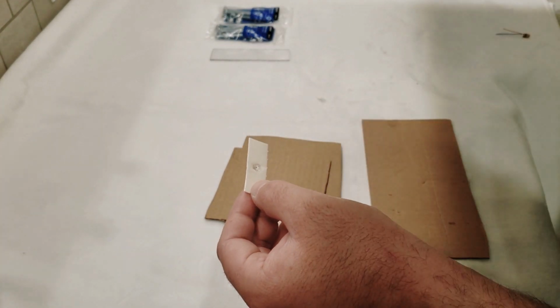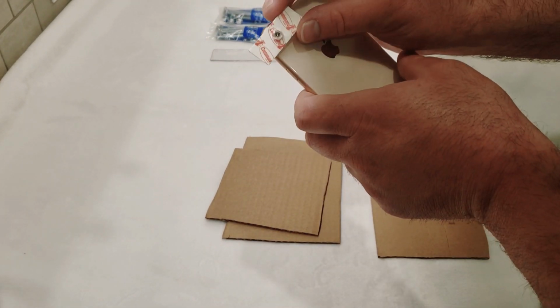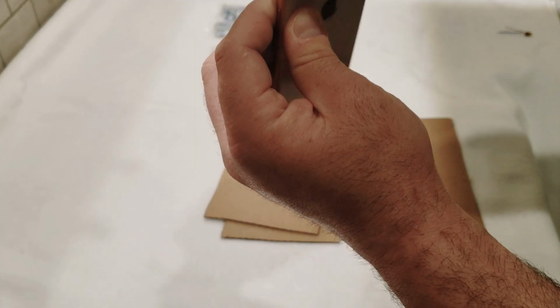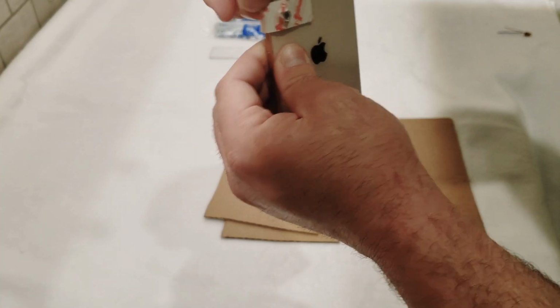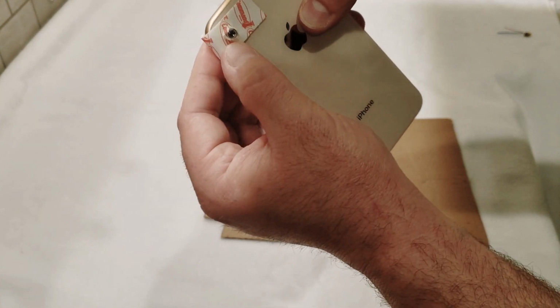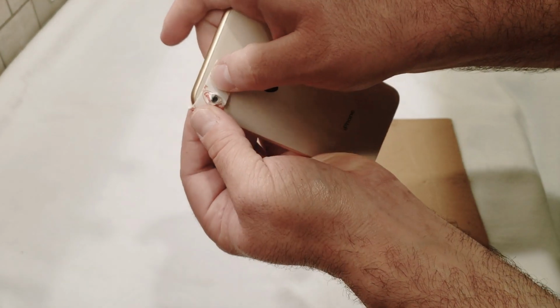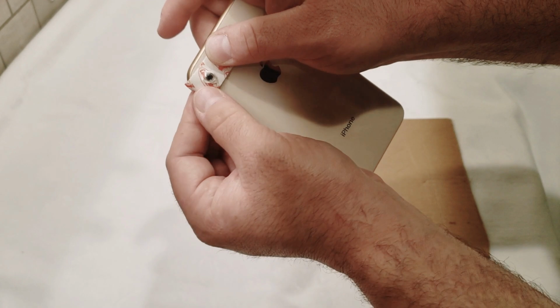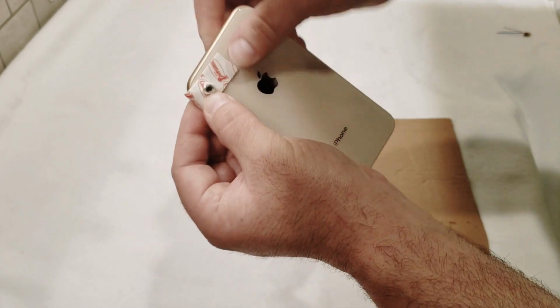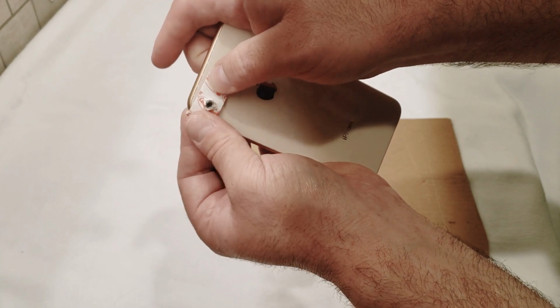Okay, whoops. Didn't quite toss that where I wanted it. We're just going to put it right over the lens. We just want it to be as snug to the phone as possible. This is why, if possible, I like using a sticky tack or a mounting putty, because it's actually a lot easier to mold down. Kind of hold that. But this will work too. And it comes off pretty easy, so.